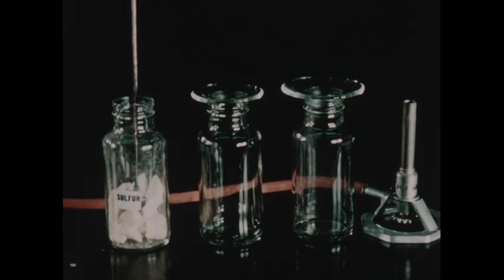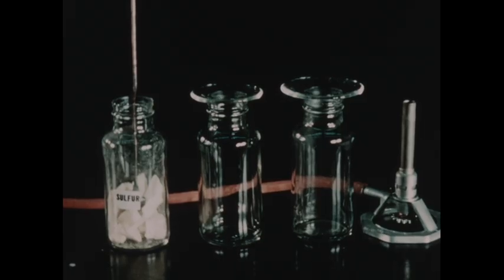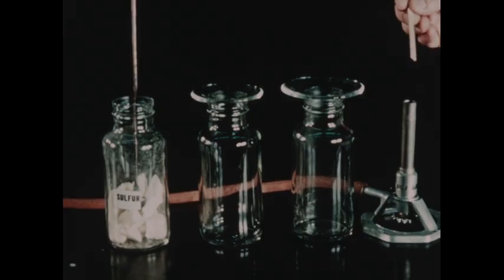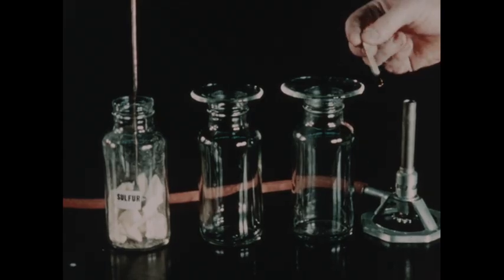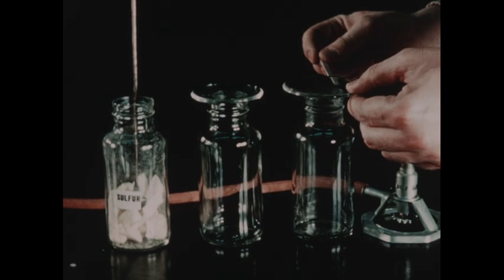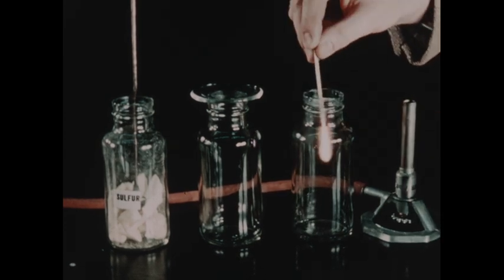Nitrous oxide decomposes when heated to a moderate temperature into a mixture of nitrogen and oxygen. It is the only other common gas besides oxygen which will cause a glowing splint to burst into flames, as we can illustrate on one of these bottles of gas we have collected.